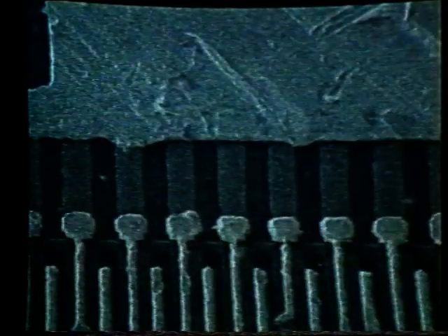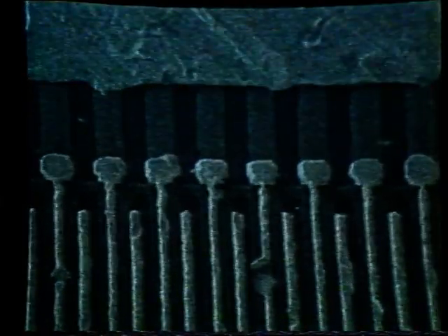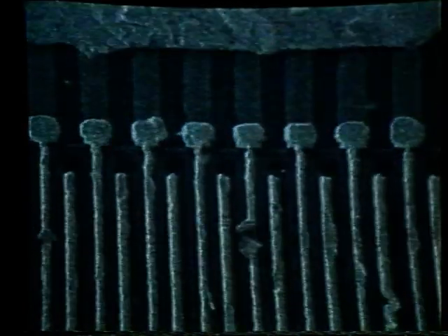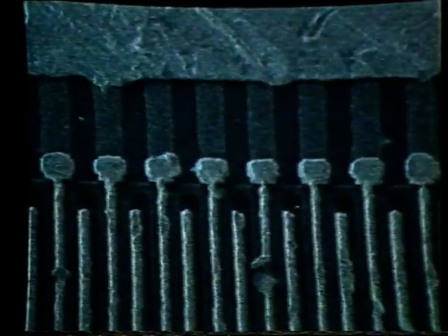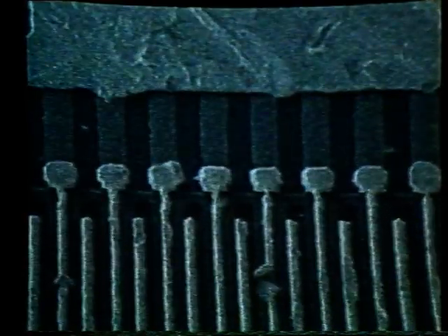The easiest way, once again, is to go too far and to see whether it gets better or worse. We now see that there is more movement, so we will slew the Y value in the opposite direction. We now see it getting worse again. So we will slew to minimize that movement. We now see very little movement.